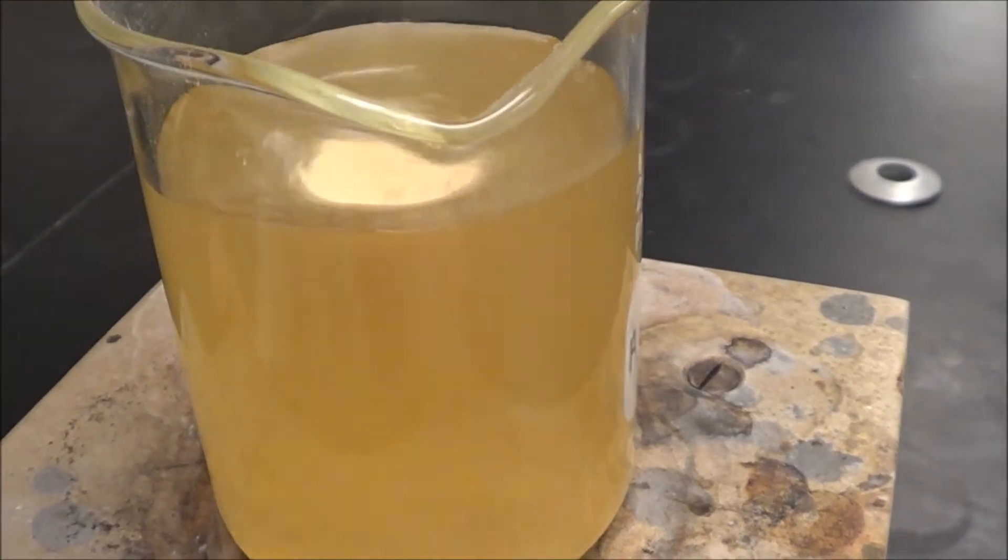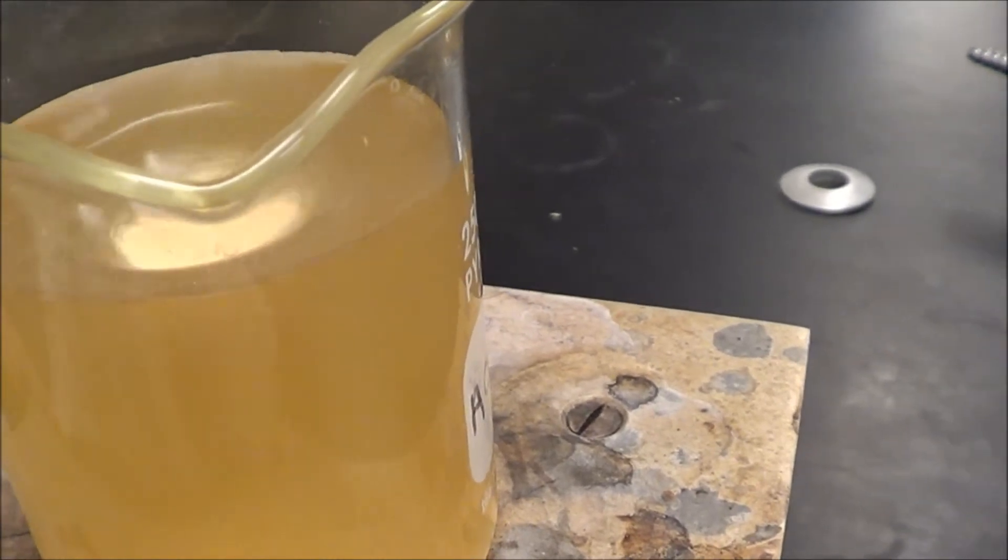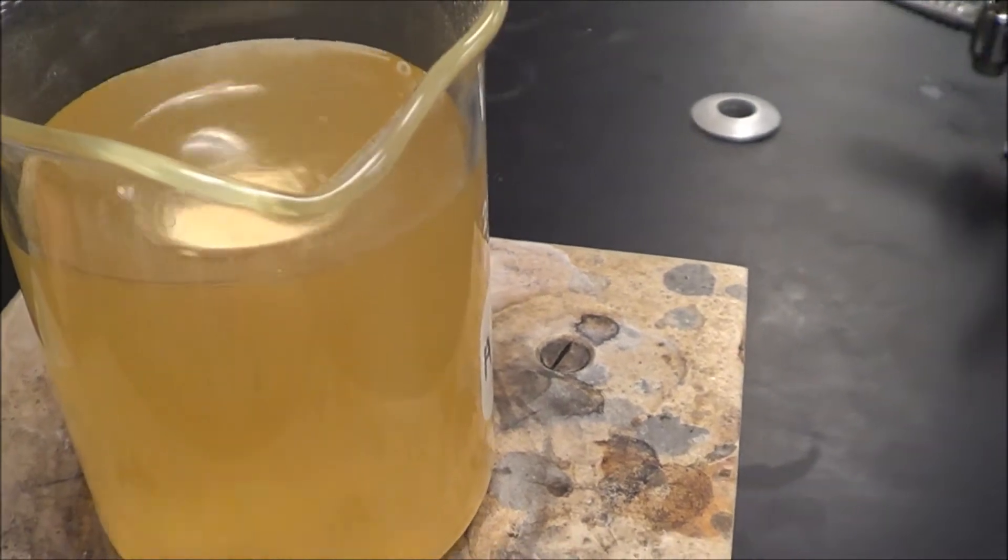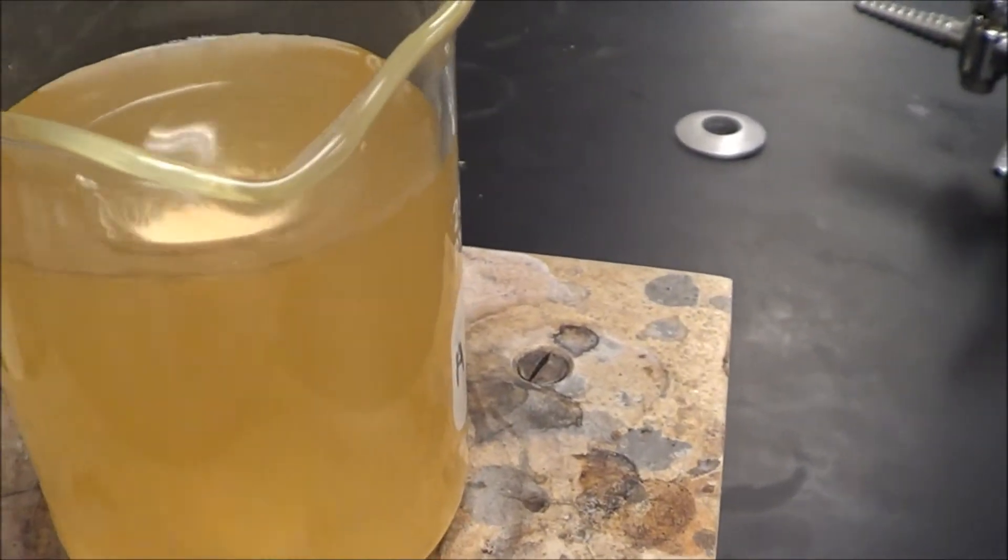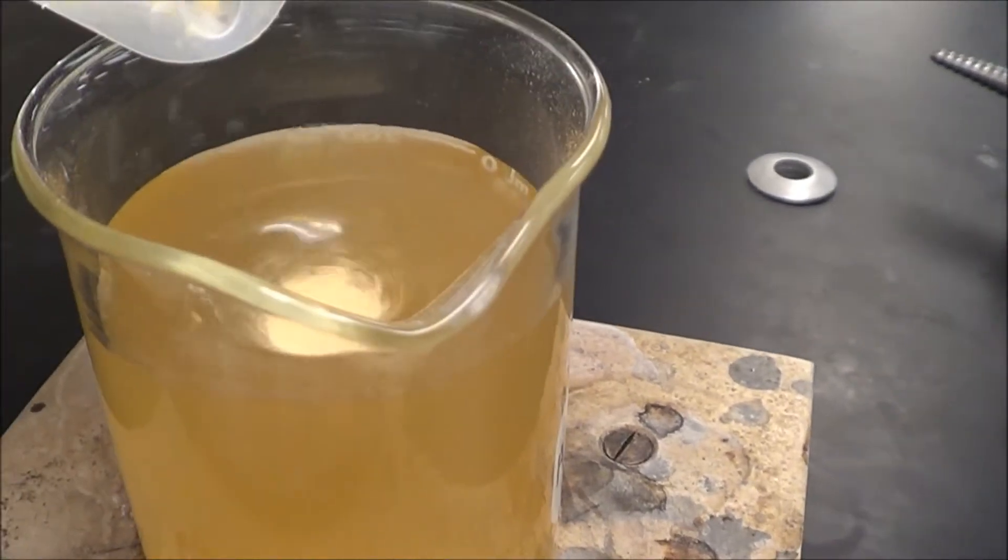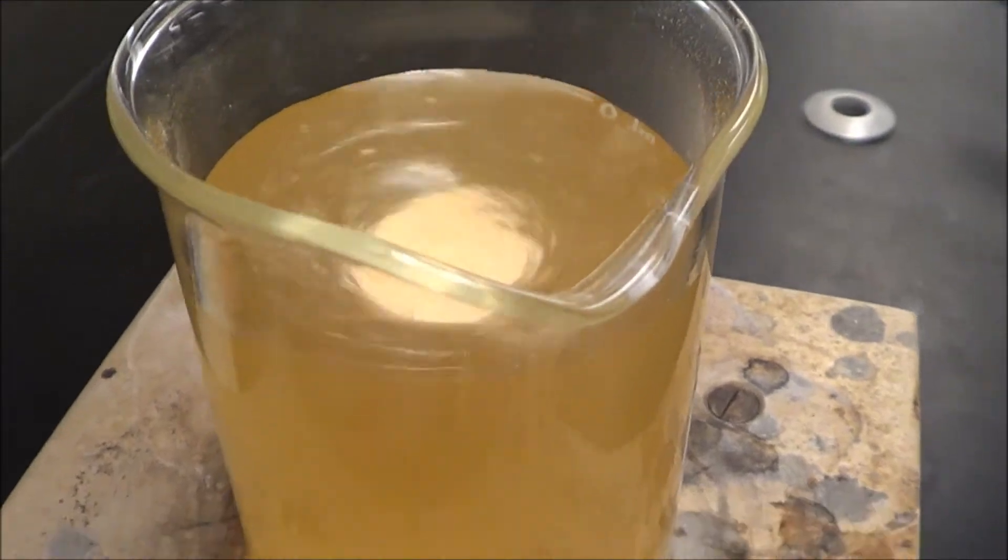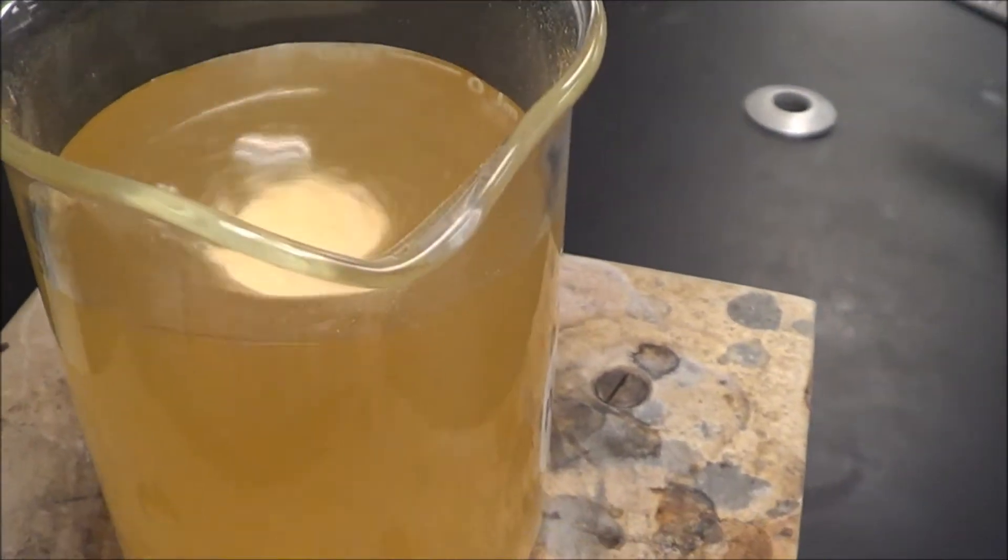This is kind of like making jello a little bit, but except it grows bacteria. Speaking of which, you can make an agar with gelatin but it doesn't have nutrients in it. So you would probably have to add some nutrients in there, but either that or you can just buy the store-bought stuff.